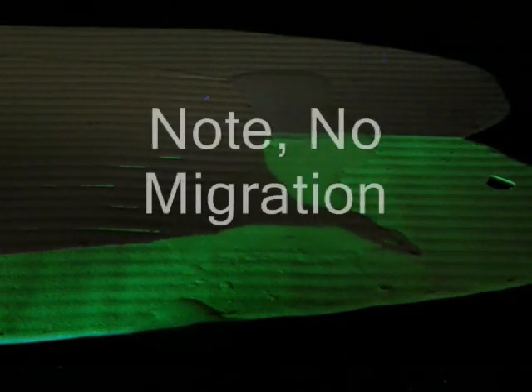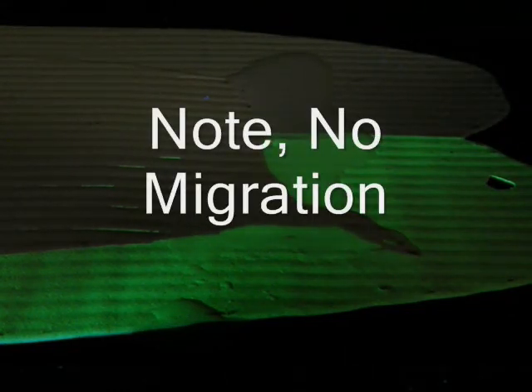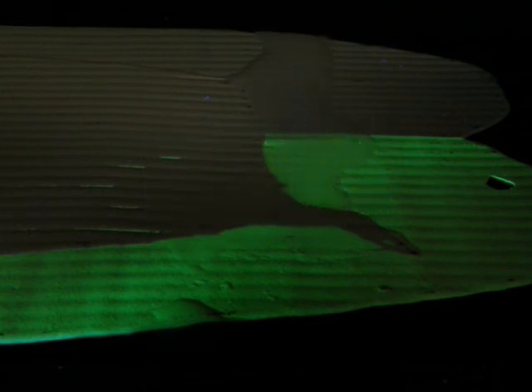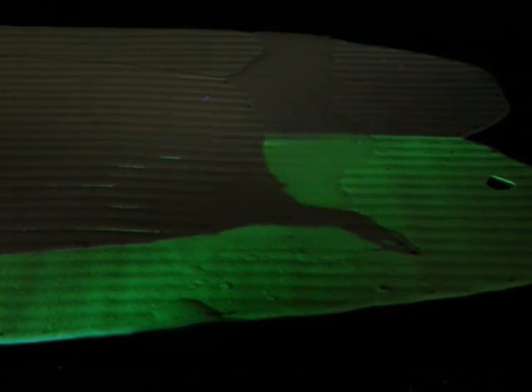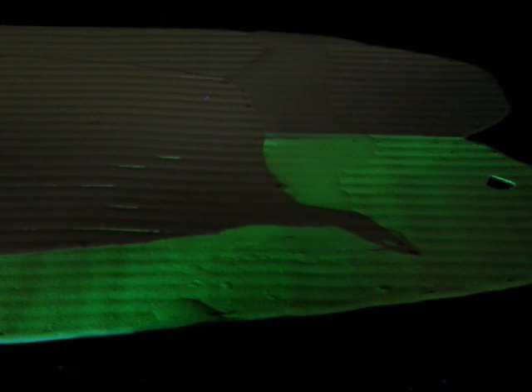Note there is no reaction. Inorganic optically active additives do not migrate from the film with solvent.